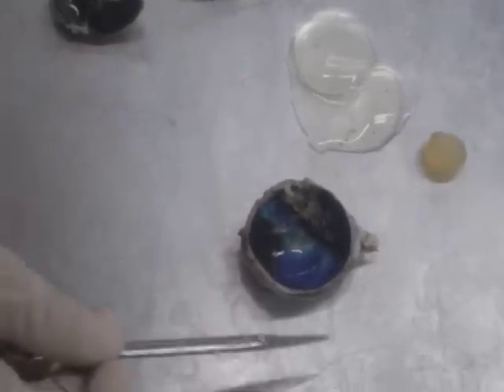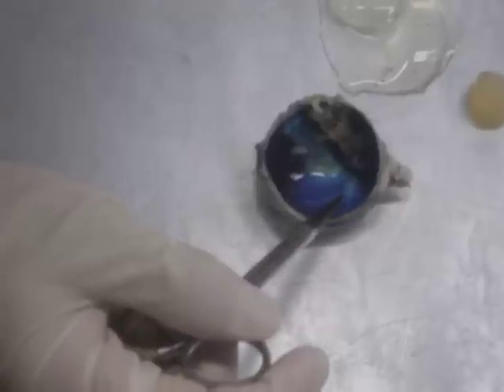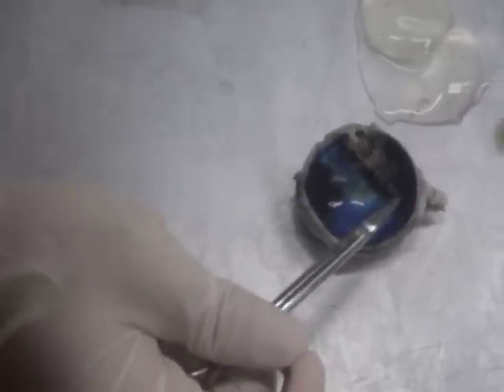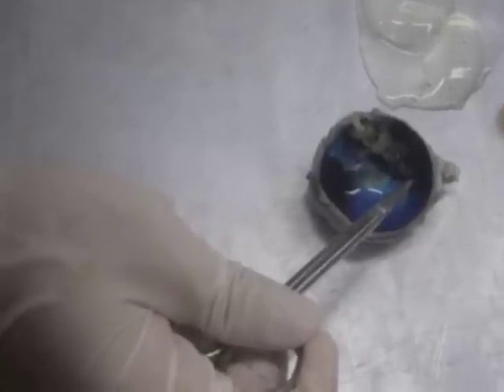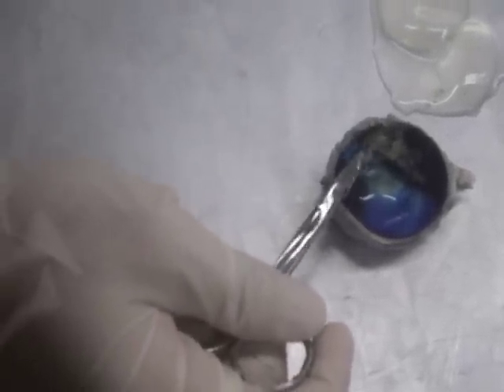We're going to go into, along the back inner side of the eyeball, we have the tapetum lucidum, which is the colored stuff. And the pigmented retina, which is the black filament on the back side, and then the unpigmented retina, which is the cream-colored film that was covering all of that.